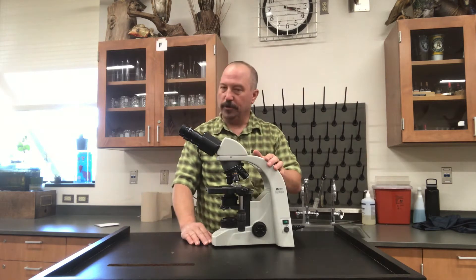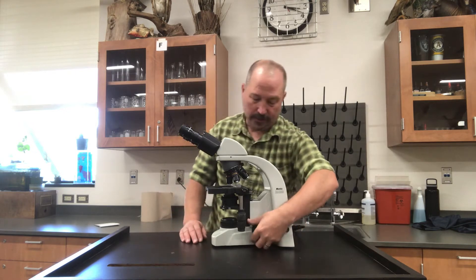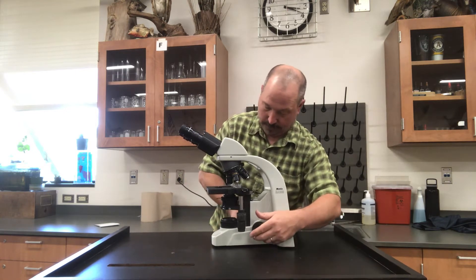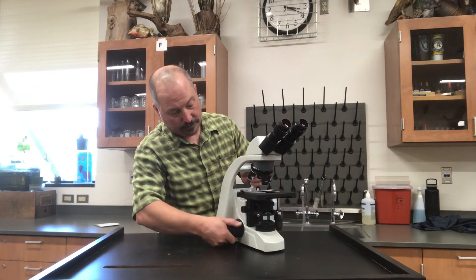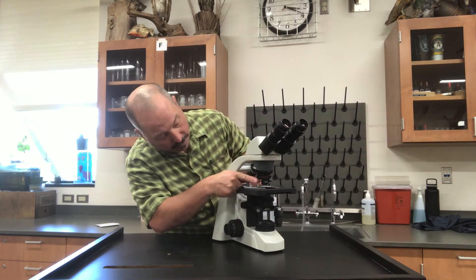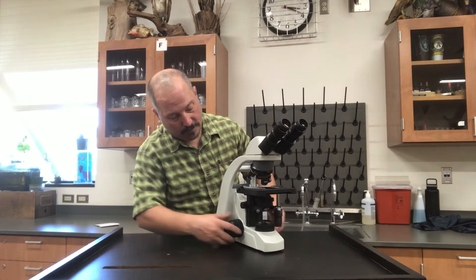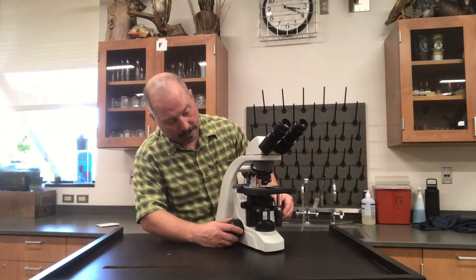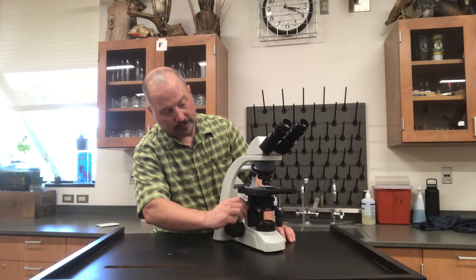When you get the microscope, you want to make sure that the stage is all the way up. This is also how you focus. Make sure that it is on the lowest power, which is the 4X, also known as the scanning lens — in our microscopes, it's the one with the red band. Make sure that's all the way in, and also make sure that the condensing lens is all the way up. That's where you're always going to start.